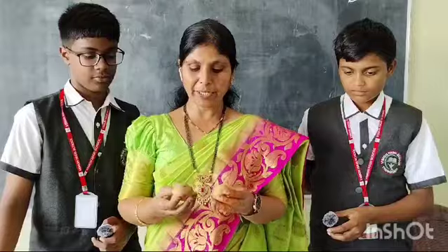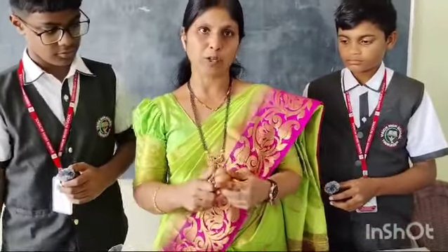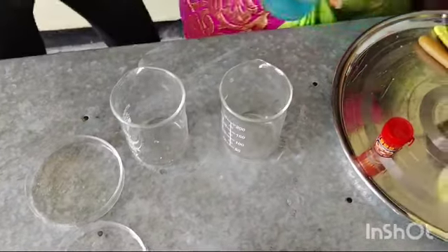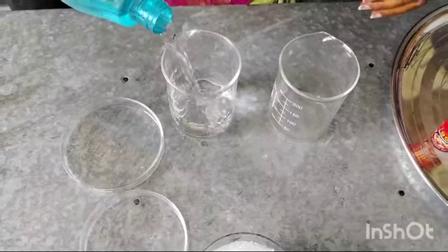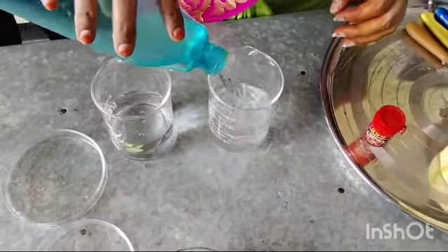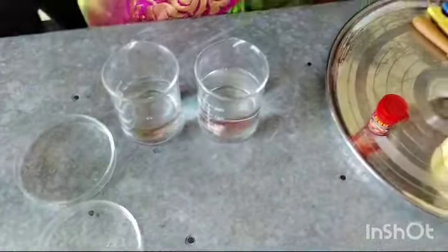Now take two potatoes. Peel the potatoes and make two potato cups. Now take water in two beakers. In one beaker, make a saturated sugar solution.